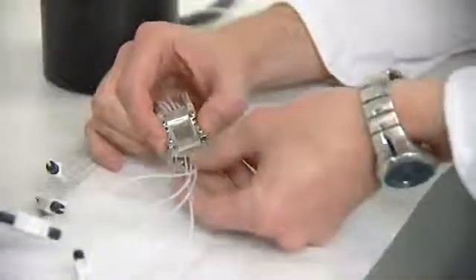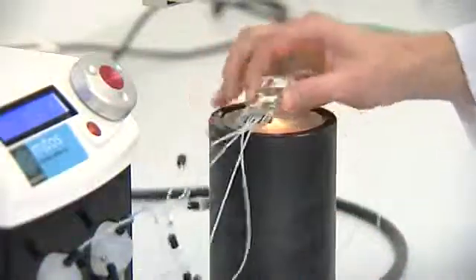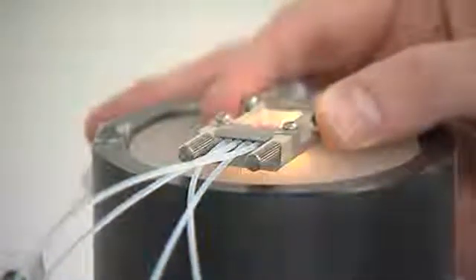This takes a few seconds and needs no tools. Then the edge connector is fitted to the chip holder to create a pressure tight seal. The connector seals to 20 bar and is highly chemically resistant.